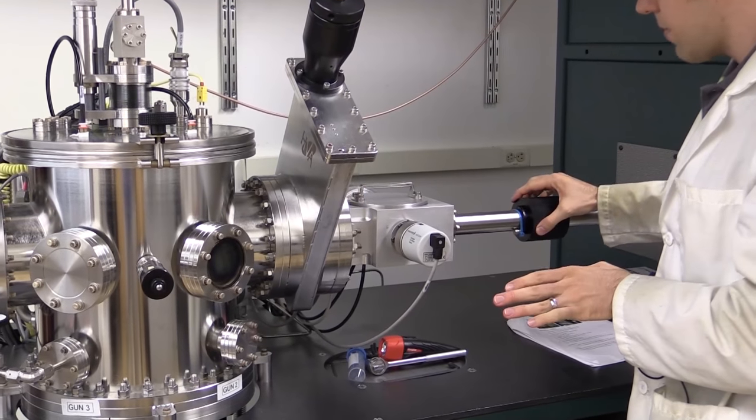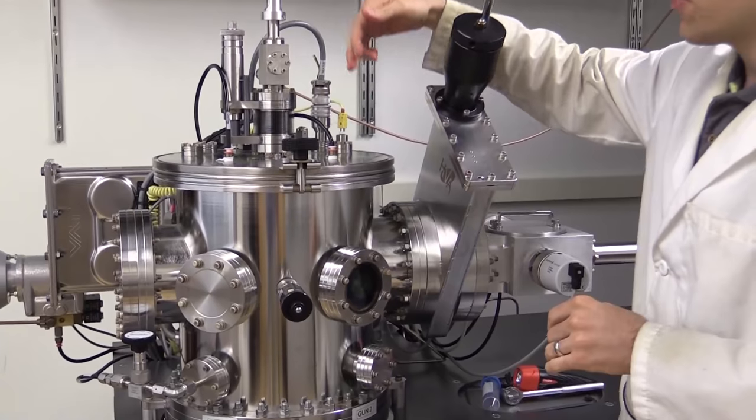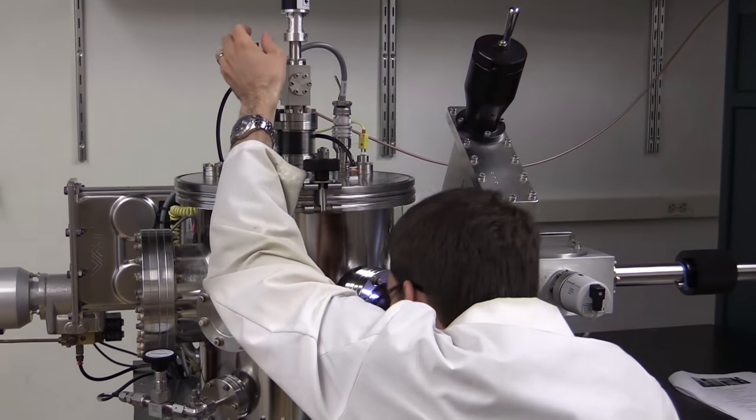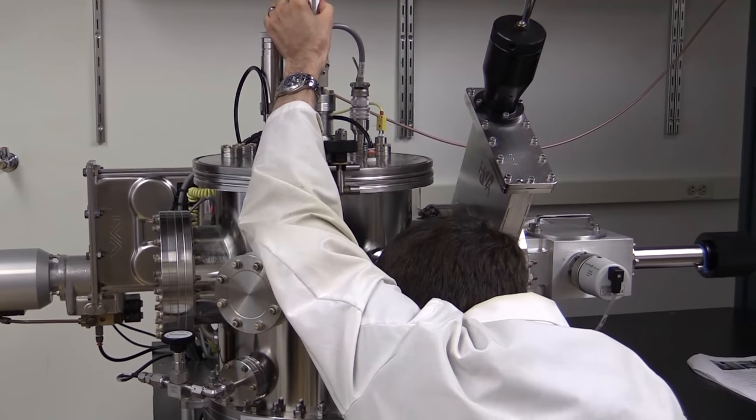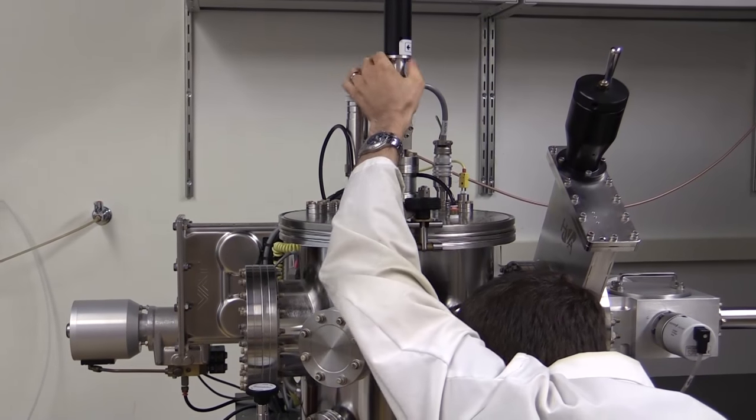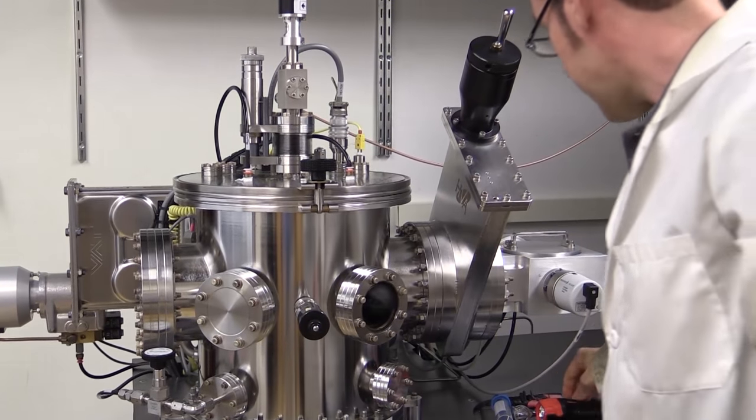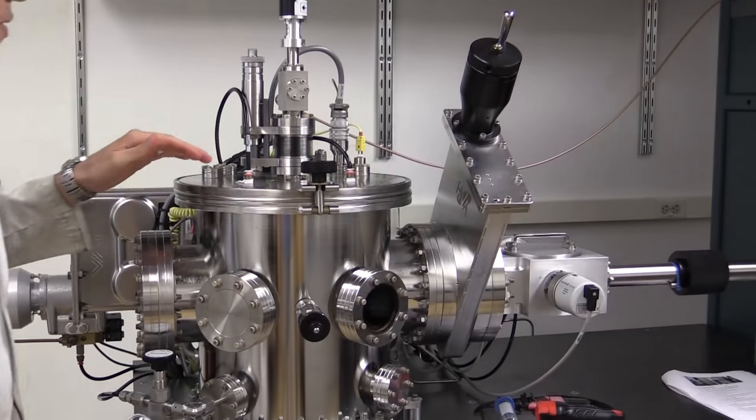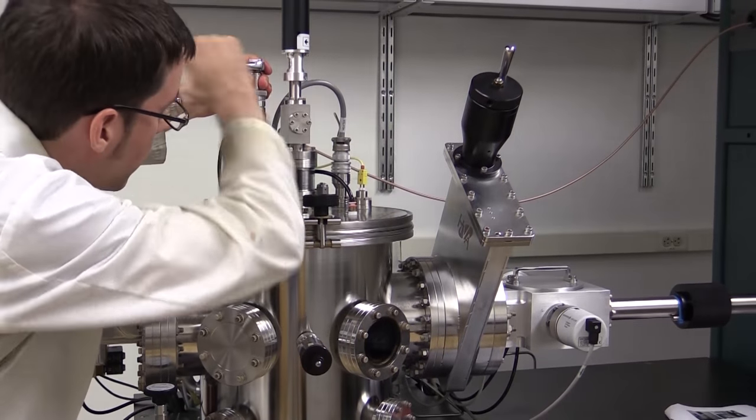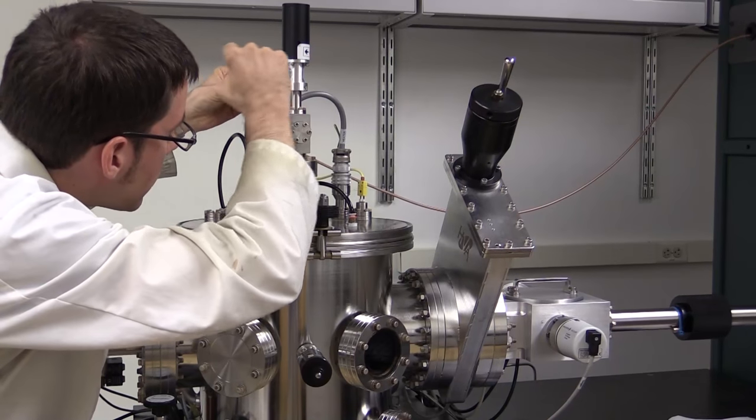I slide over the magnetic manipulator from the load lock to the main chamber. Now I'm going to capture the substrate holder with our propeller. I've captured it and now I'm going to return the substrate holder and propeller up to the 30 millimeter height.